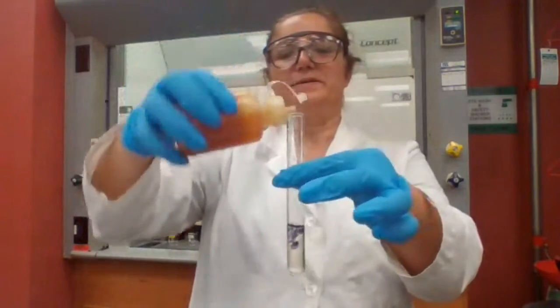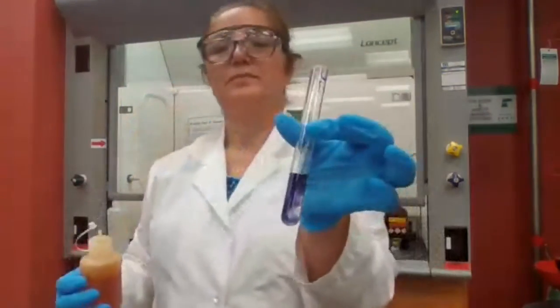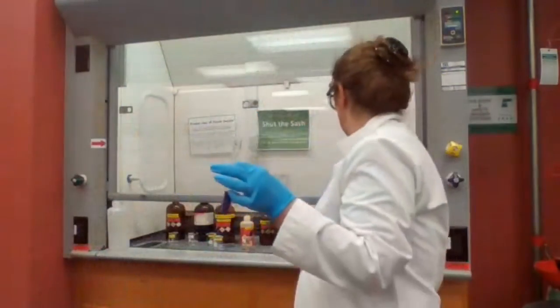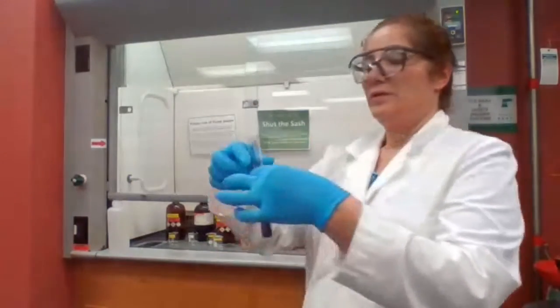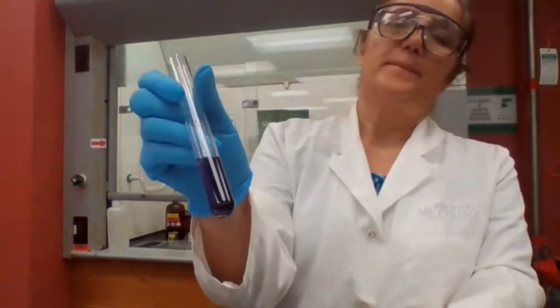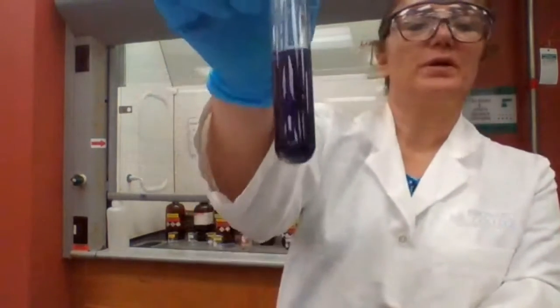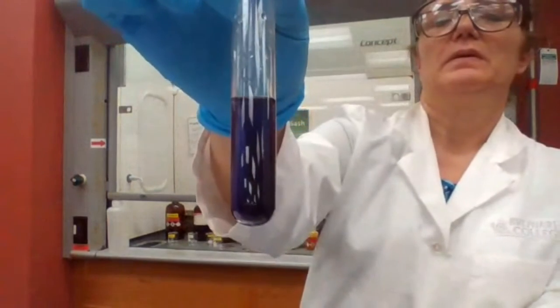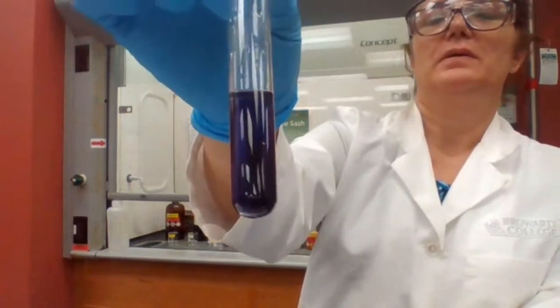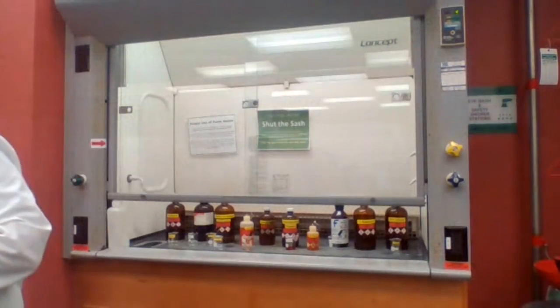What do you expect? Formation of a strong color. That means you have phenol with the ferric chloride. Next one.